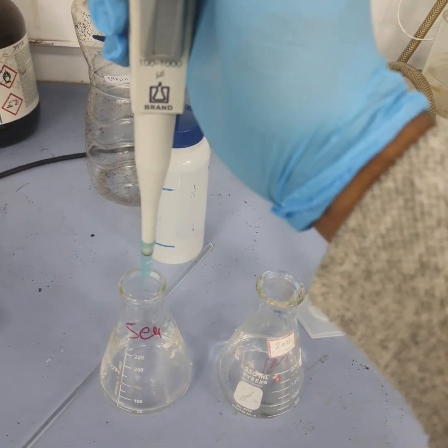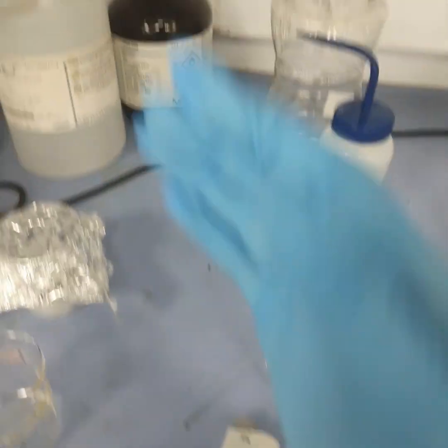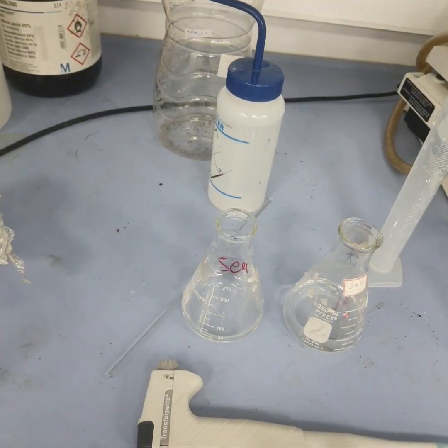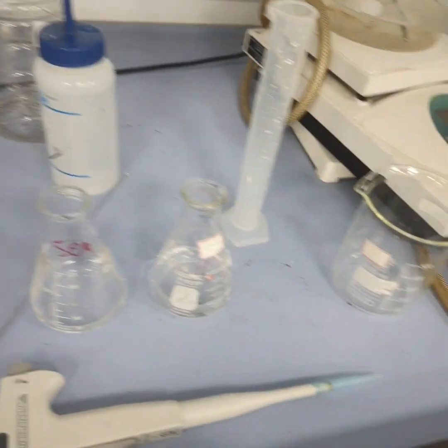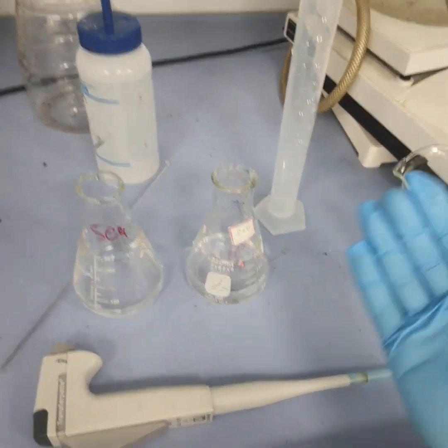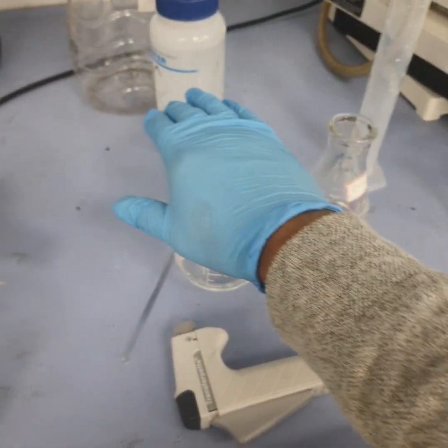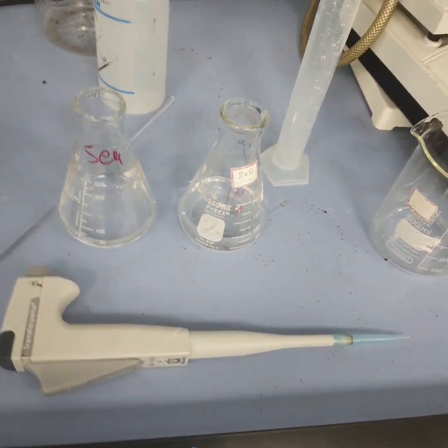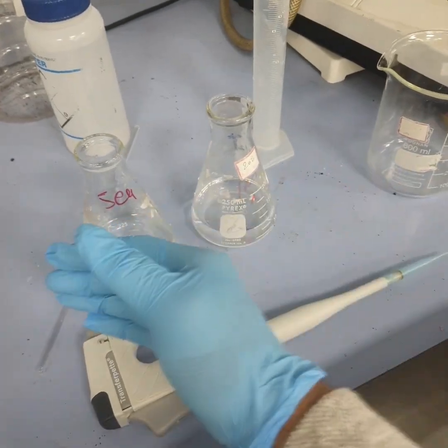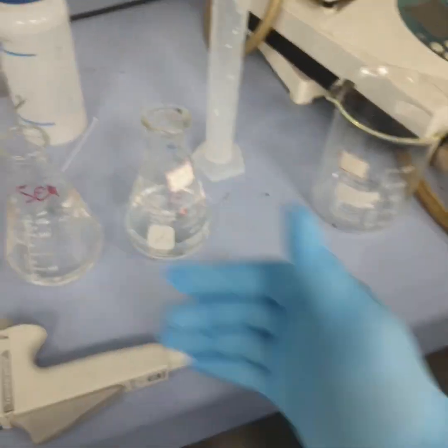Now this was all about the preparation of the lower dilution from the main stock. If we have another acid, you can apply the same concept and formula to prepare your lower stock. Suppose you have these stocks, this is 6 and this is 1. If you want to go from 6 to 2 or 3, you can use this as stock, or if you want to go from 1 to 0.1, 0.01, you can use this main stock. So you have to be very clear about the serial dilution concept. Also we need to homogenize the solution. You can add a bead and shake it for a few minutes so that the solution is homogenized. This is not homogenized right now.